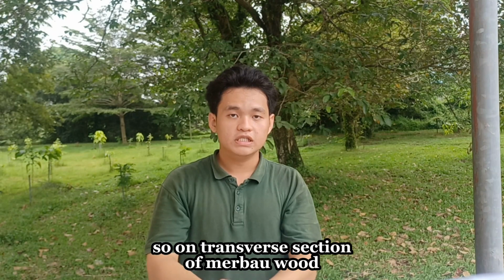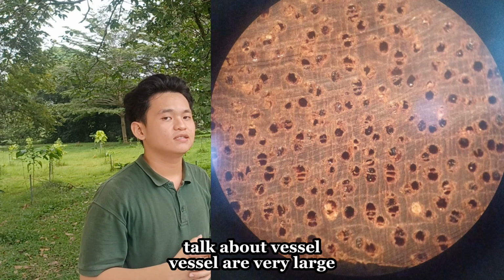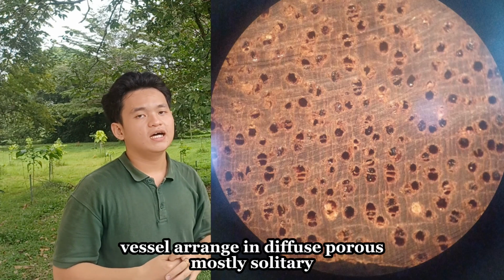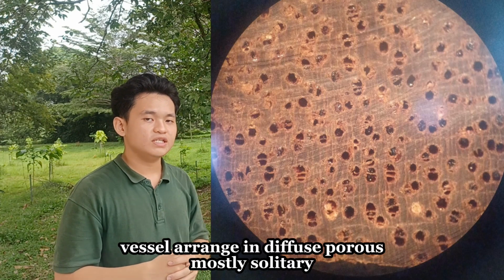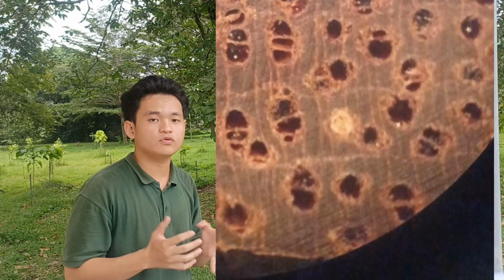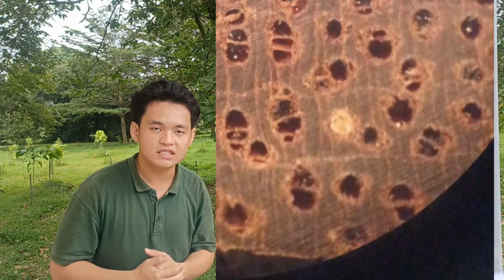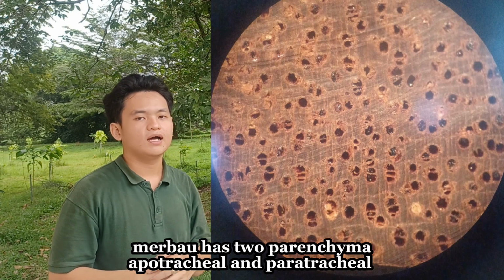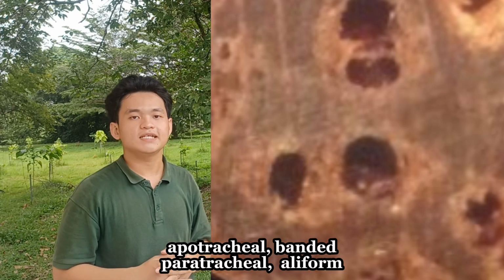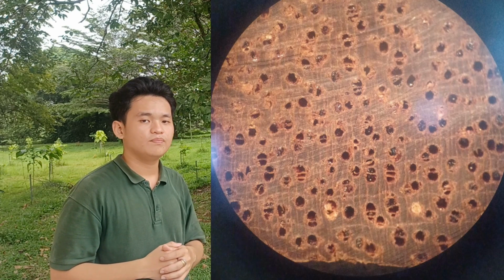What we can observe on the transverse section of merbau wood, first of all, is its vessels. Vessels are very large and the shape is very round. The vessels are arranged in diffuse porous pattern and mostly solitary. Sometimes you can find a few pairs or groups of up to 3 vessels. You can find a yellow deposit common in the vessels of merbau. Merbau has 2 types of parenchyma, apotracheal and paratracheal. The apotracheal is banded, and the paratracheal is aliform. Its rays are medium fine, but not visible.